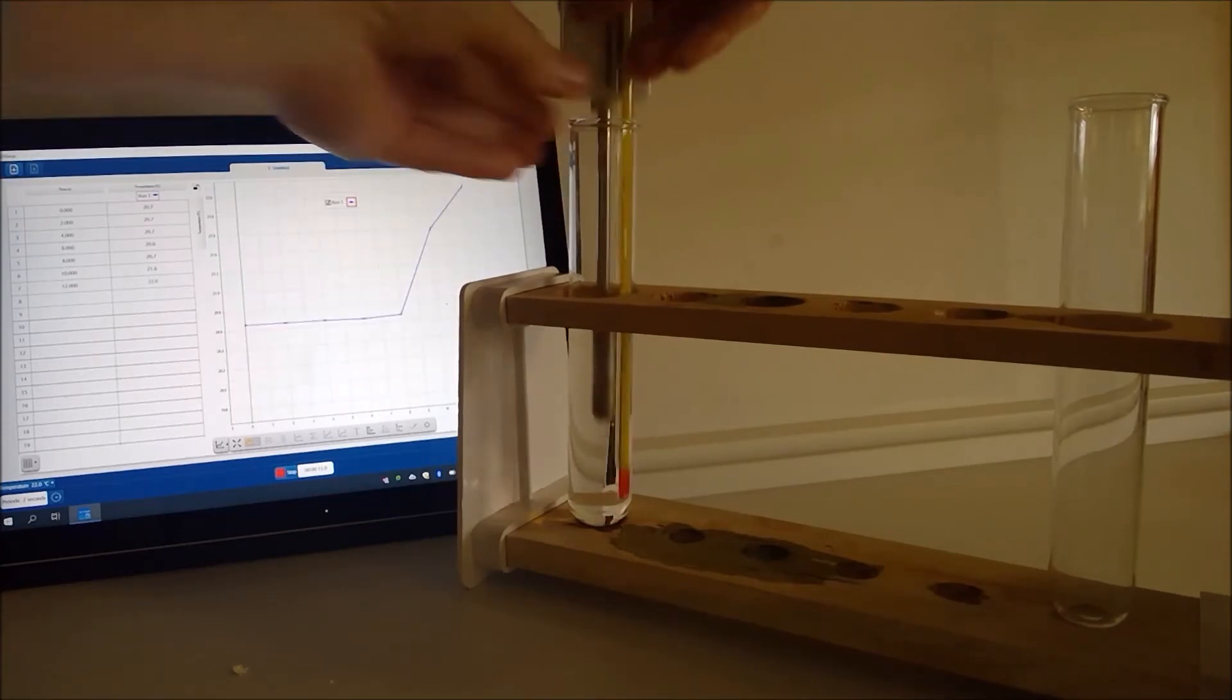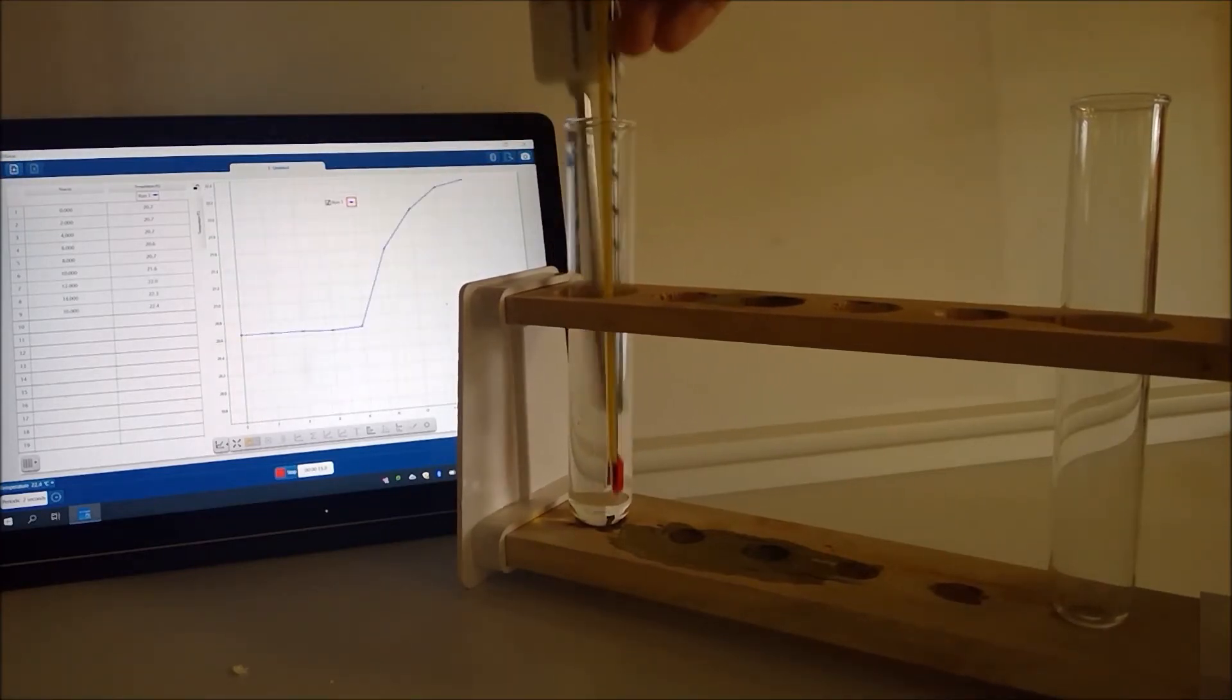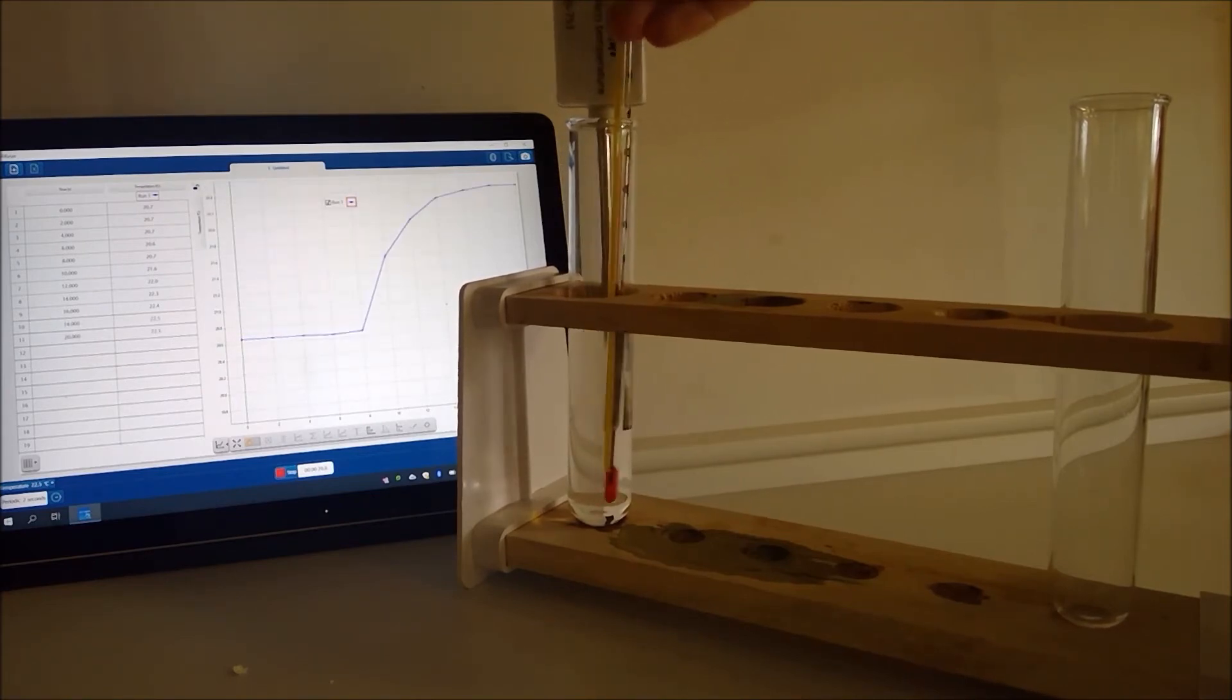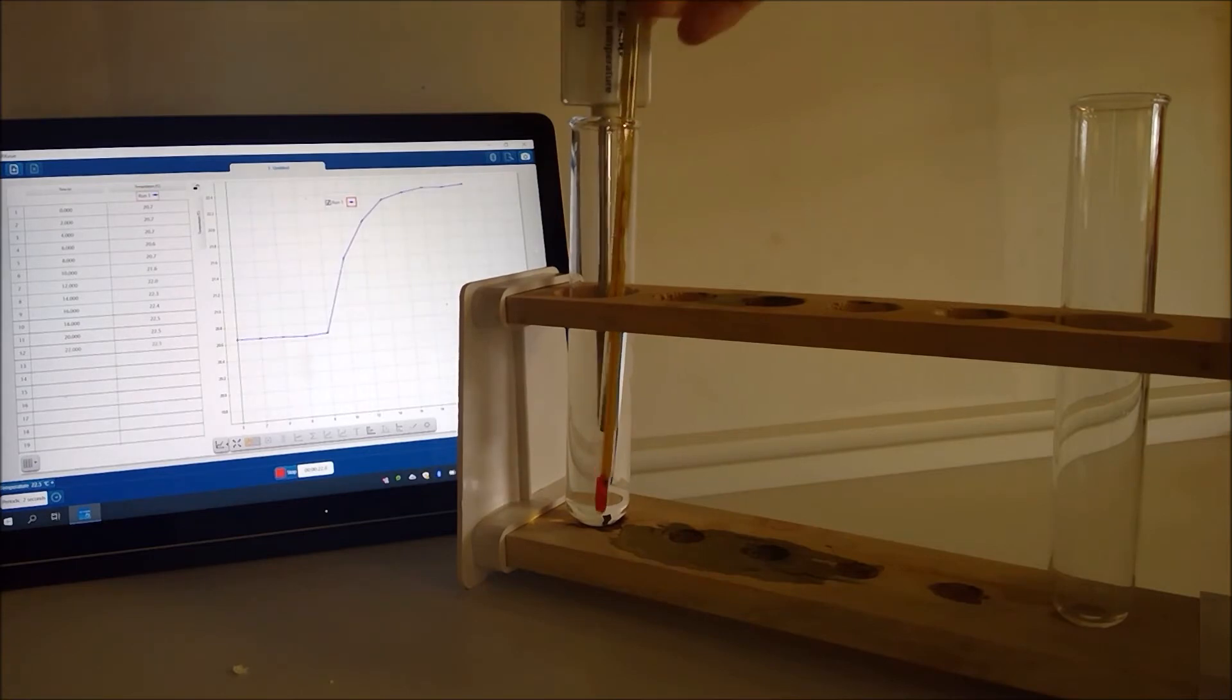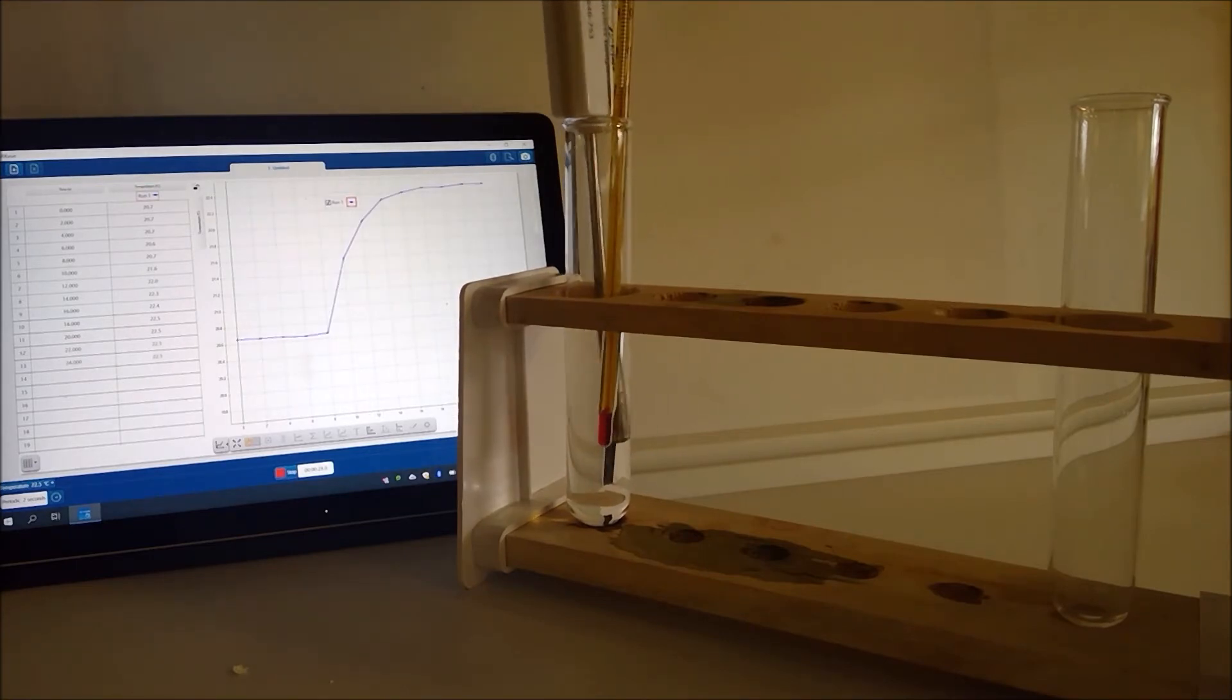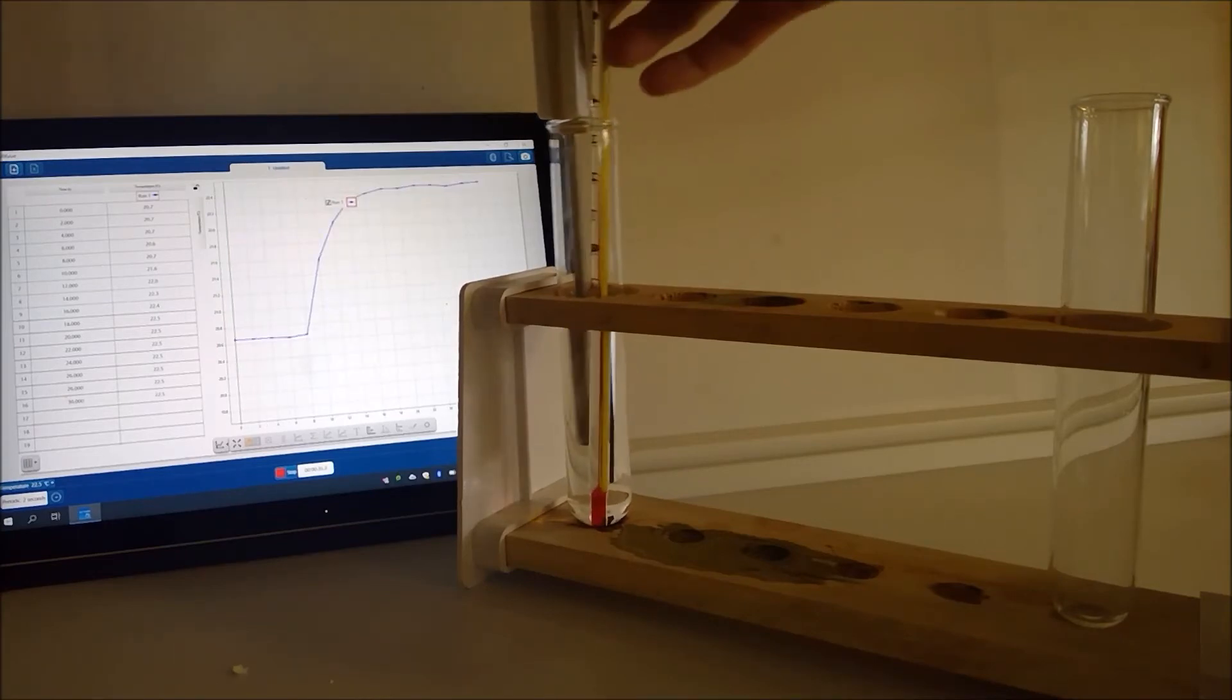So I can use these to stir as we go and there it's much easier for you then to see on the screen the change that I can see on the thermometer. So my thermometer I can see we're up to about 23 degrees now.